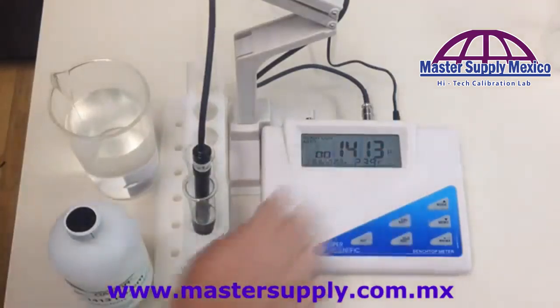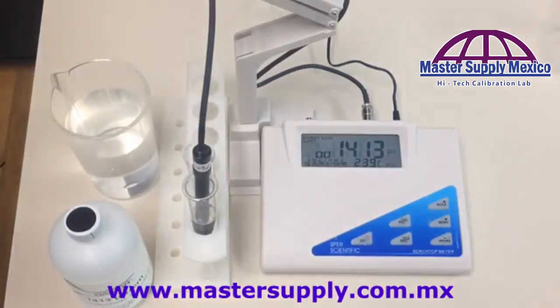If you get an error message — for example, error 17 — for any of the benchtop meters, any time you get an error message, you need to reset the unit back to factory settings. This information is found on page 56 of your manual, and it works the same for any of the meters.